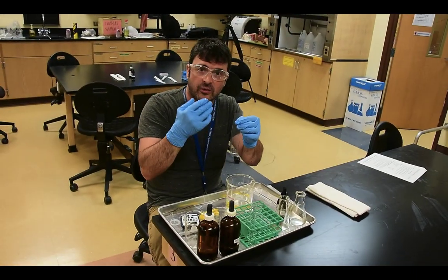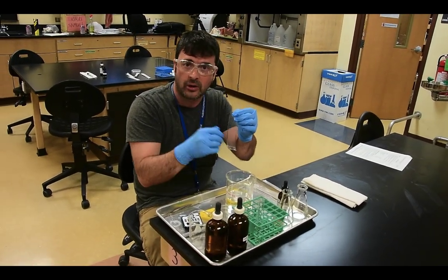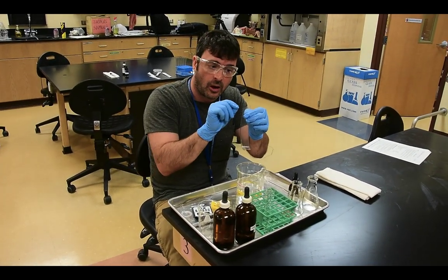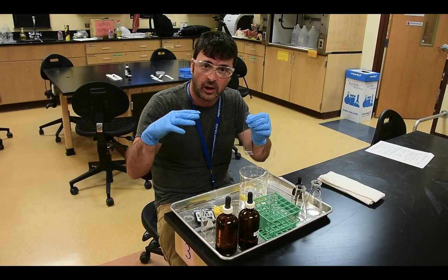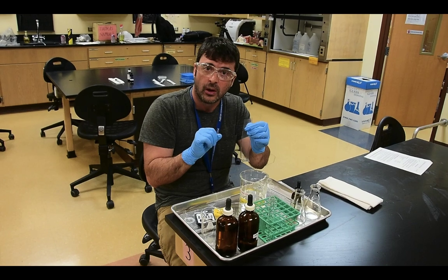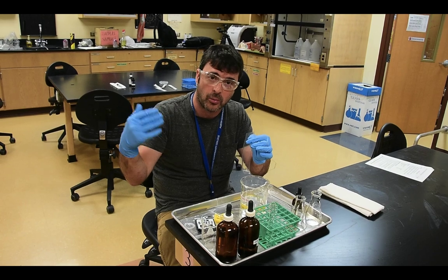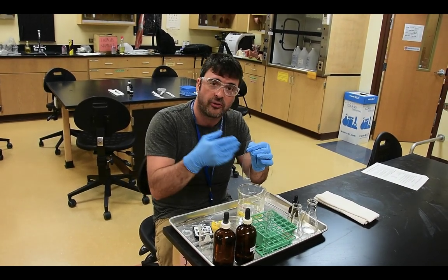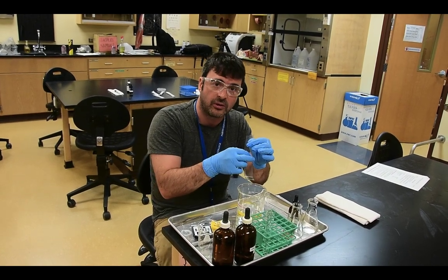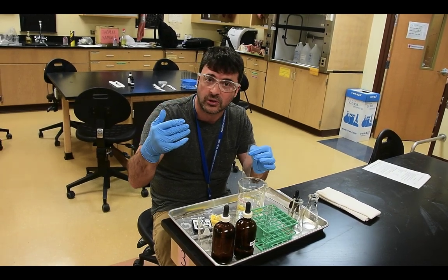Depending on the size of the pore will dictate the size of the particle or the molecule that can fit through. It's called the molecular weight cutoff. So the lower the molecular weight cutoff, the smaller the pores. The higher the molecular weight cutoff, the larger the pores. Larger pores allow larger solutes through. Now, dialysis tubing, just like a cell membrane, is a selectively permeable membrane, meaning that it allows certain stuff across but not other stuff. So we're going to evaluate the permeability characteristics of this membrane, and in doing that, we're going to look at the processes of diffusion and osmosis.